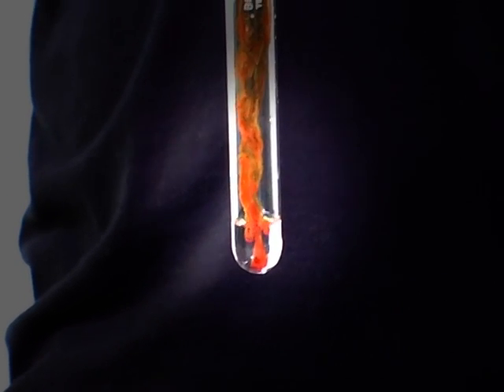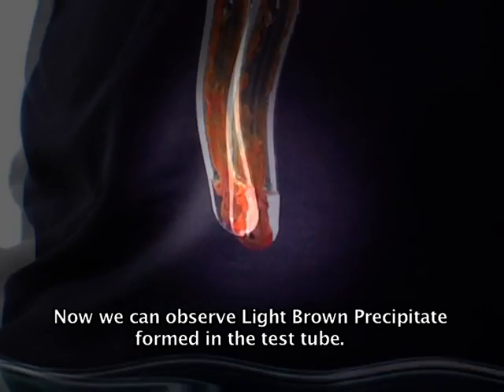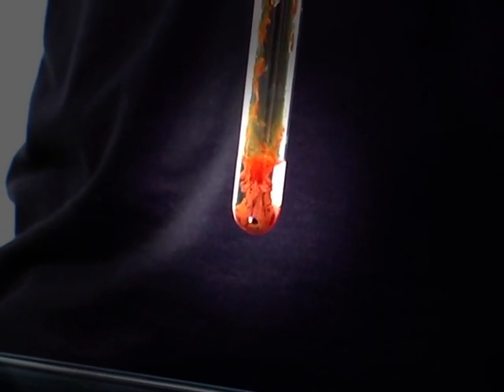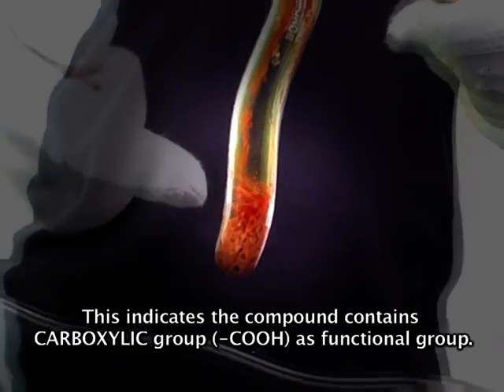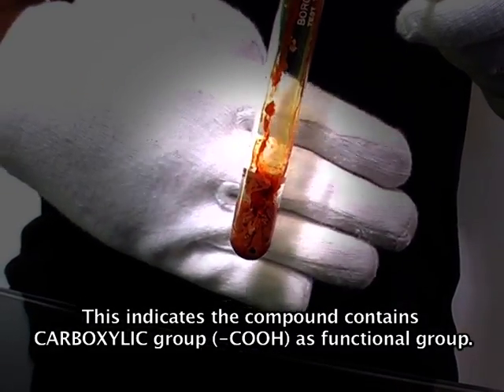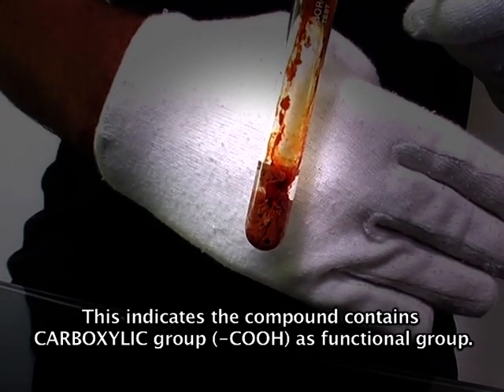Now we can observe a light brown precipitate formed in the test tube. This indicates the compound contains a carboxylic group as its functional group.